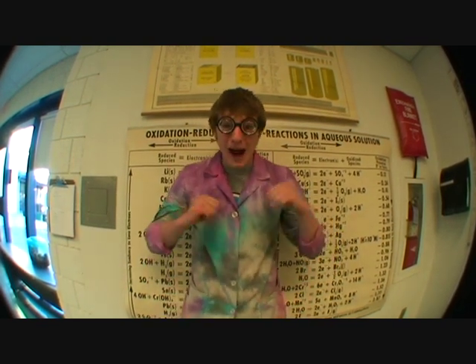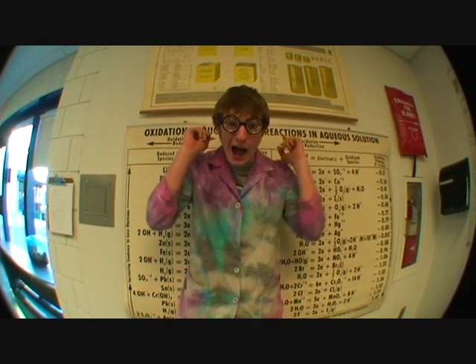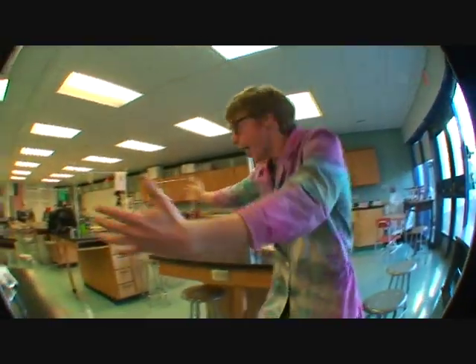Hi everybody, this is my safety video. My name is Professor Dingleberry Rafflebottom, and I'm here to teach you all the safety tips you could ever need to know. And this is my lab.